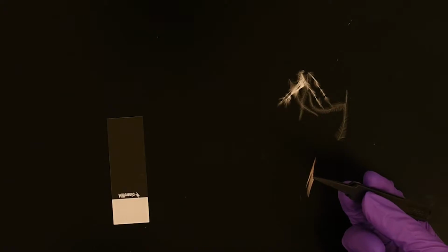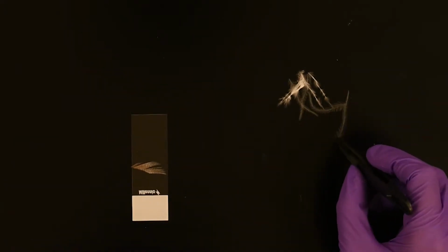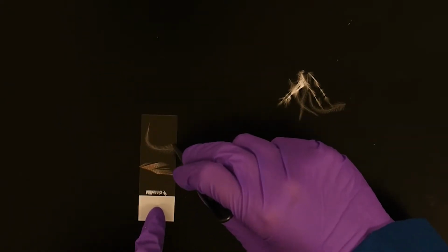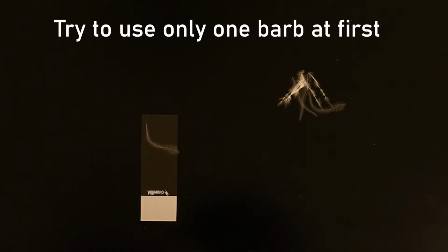Now that you have both of your feathers cut, we are going to prepare them on the glass slide. Use your tweezers to pick up the contour feathers. You can pick up as many of them as you would like, but make sure not to crowd the slide, and place them on the glass slide. After you're finished placing your contour feather, pick up one barb of the down feather and place it right next to the other feather on the glass slide. Make sure not to put it on top.